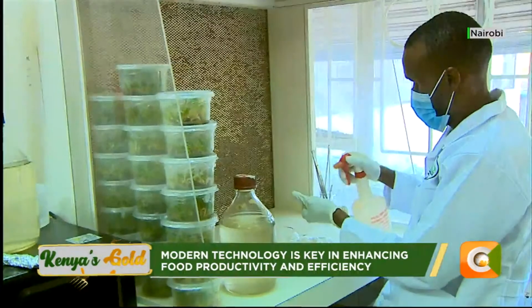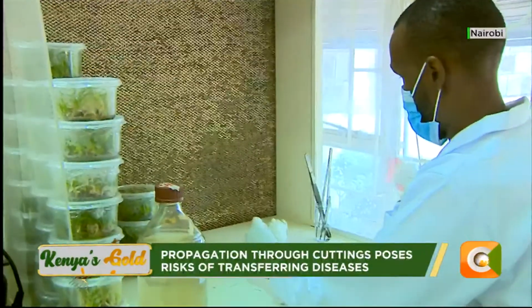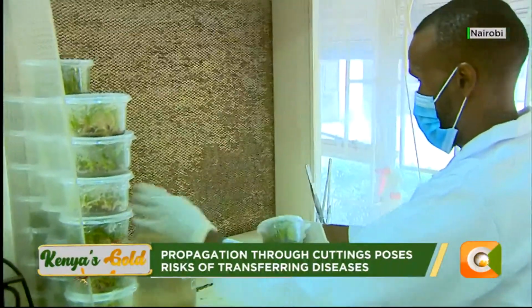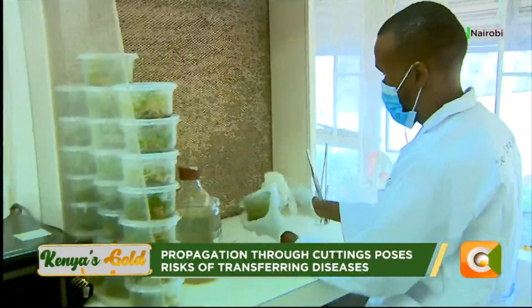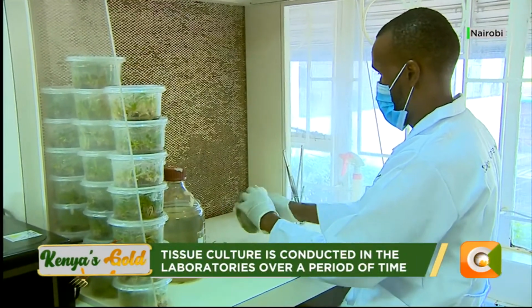And then we have the equipment, like you can see there. We have what we call the biosafety cabinets. The biosafety cabinets have been designed in a way that the working area can be made sterile. That means there is an airflow that brings in clean air throughout the time you are dealing with whatever you are multiplying.